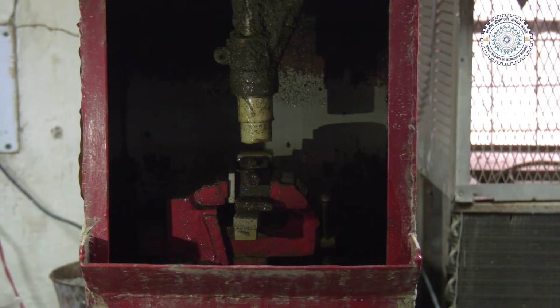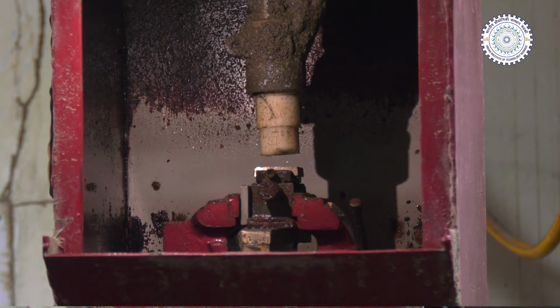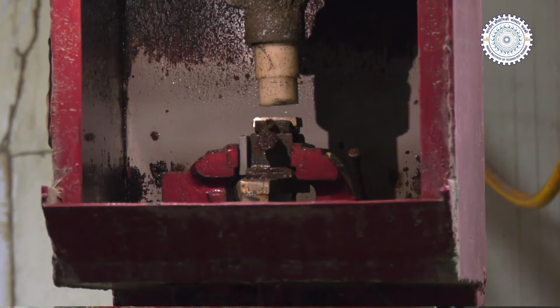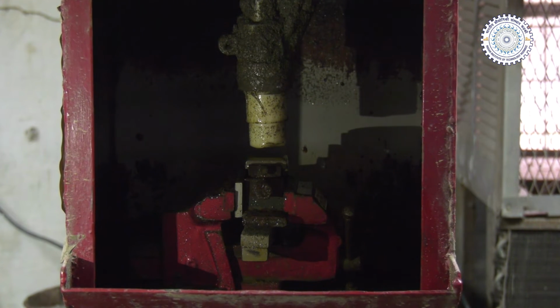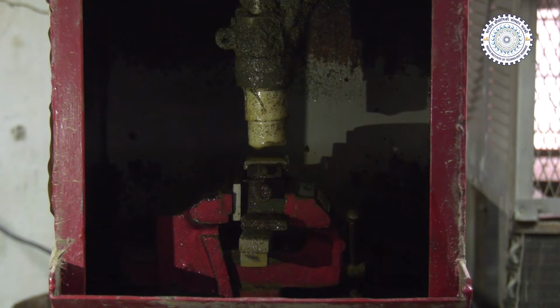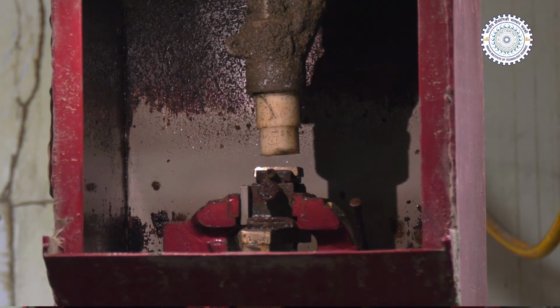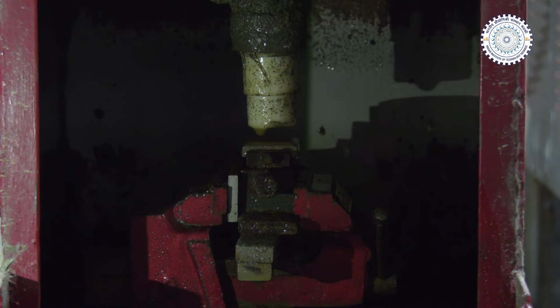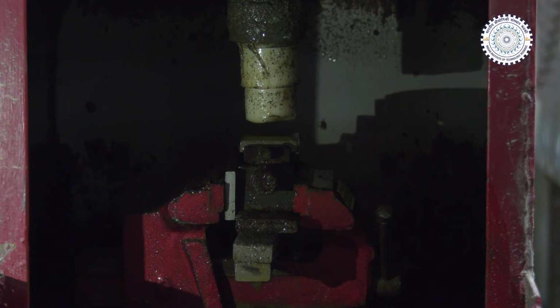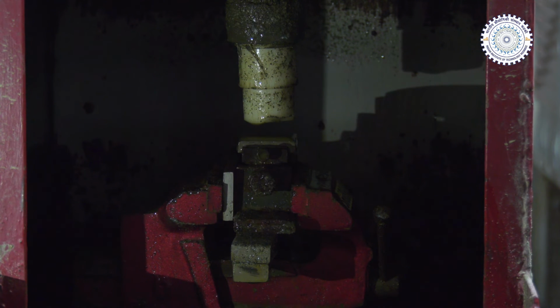Now this is the sample you can see which has been subjected to the slurry erosion test, and we can take the weight of the sample after the test to determine the amount which has been lost from the surface. The difference in weight, initial weight minus final weight, will give us the weight loss due to erosion, and that helps in determining the erosion rate by dividing by the duration for which the slurry test was conducted. That's all. Thank you.